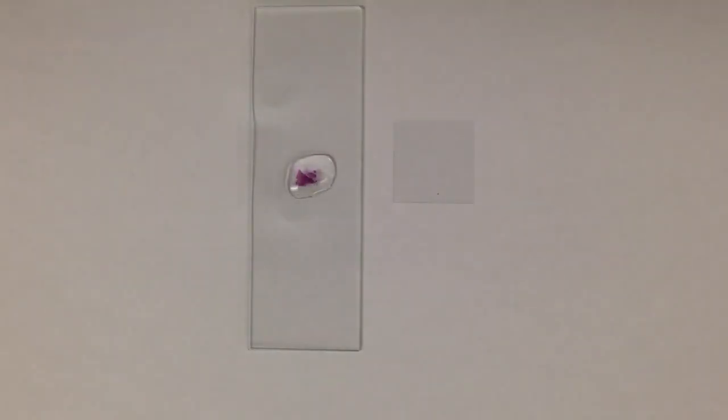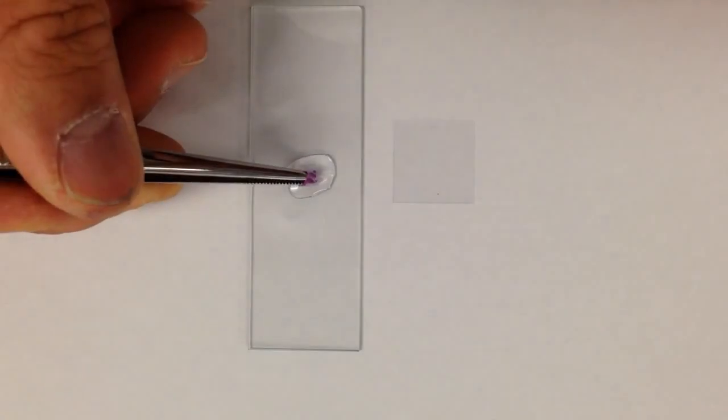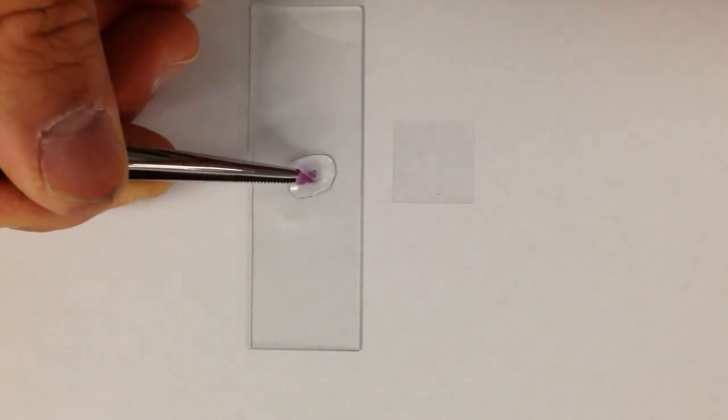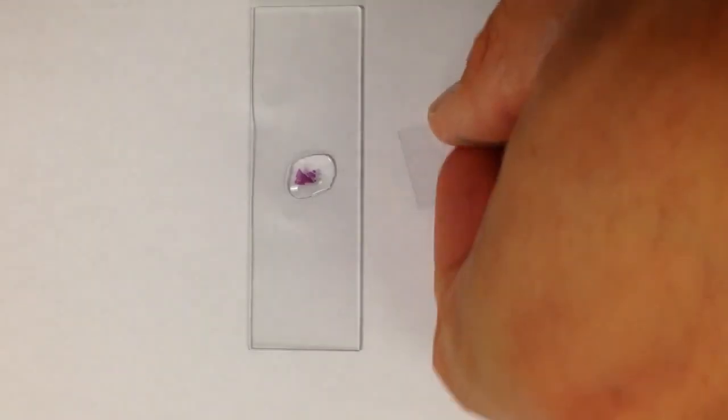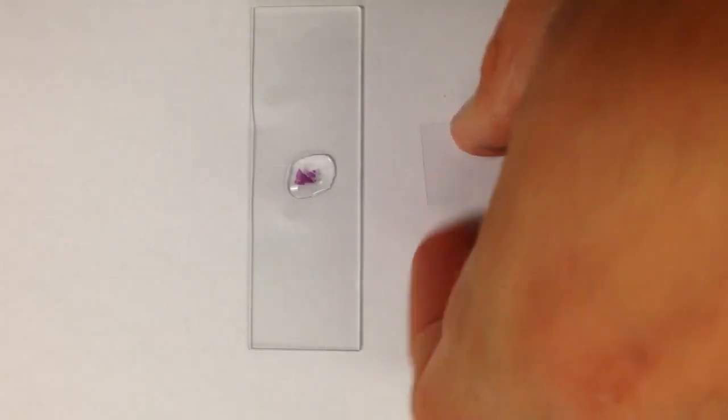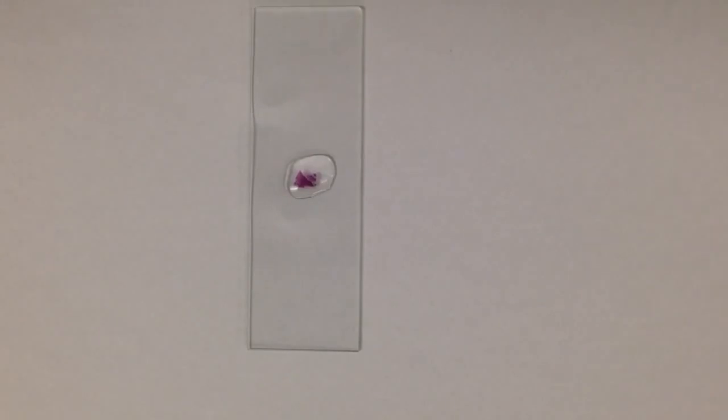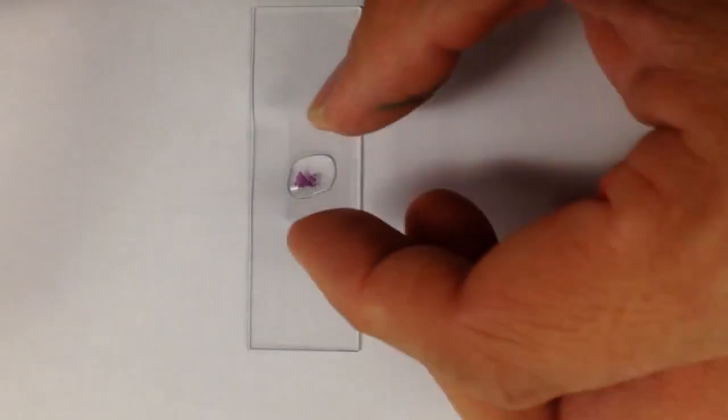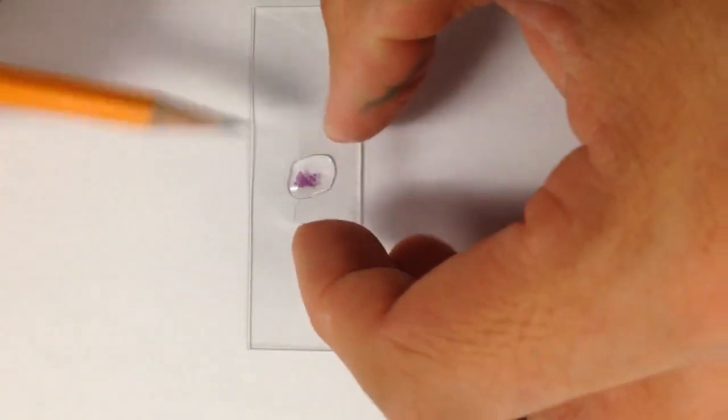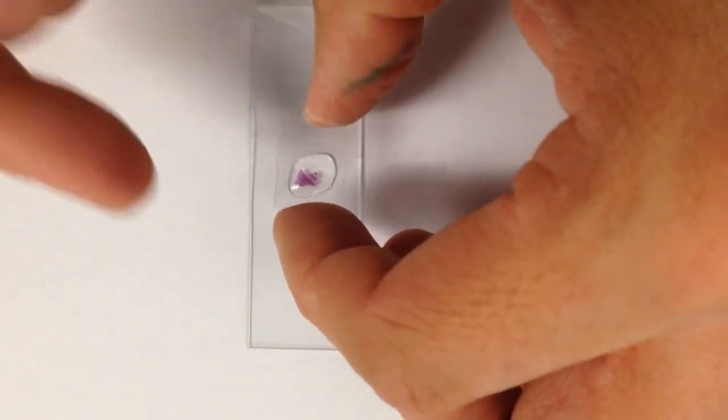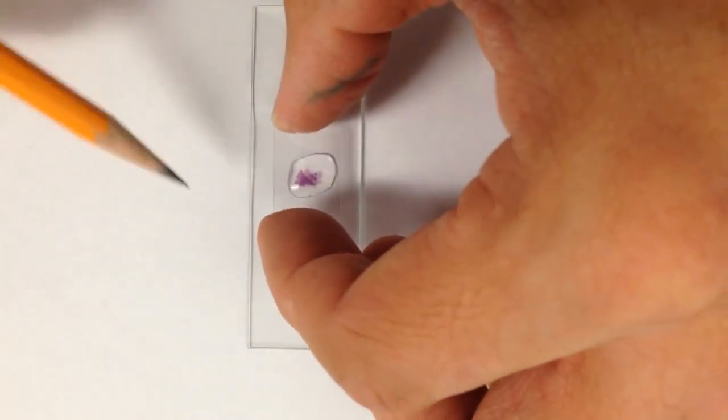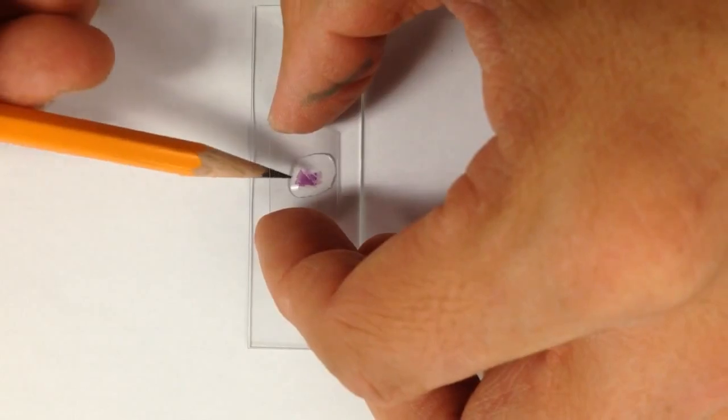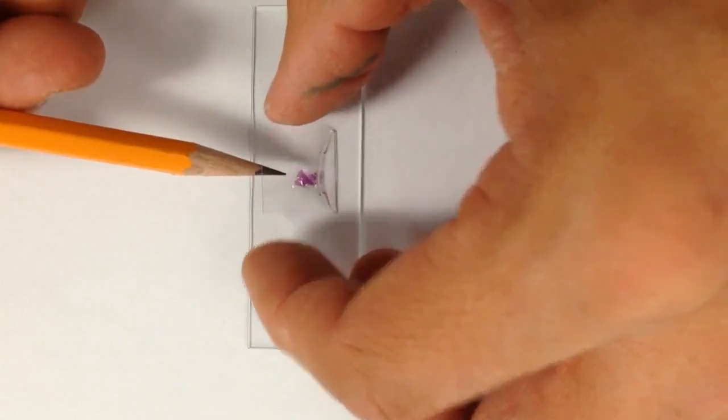So what you want to have is the specimen in the water because now what we're going to do is lower the cover slip. So what you have to do next is take your cover slip, that plastic square, and you want to position it on your glass slide, and you want to put one side of the cover slip onto the glass slide and hold up the other side with a pen or a pencil.